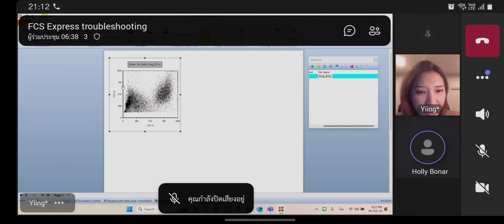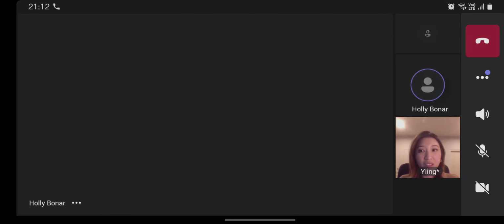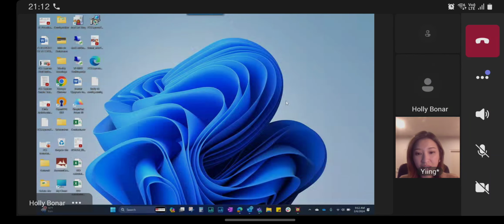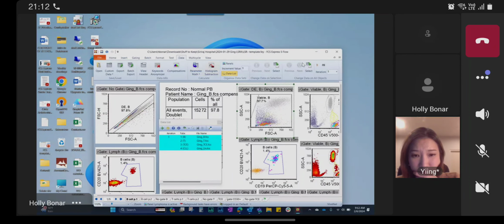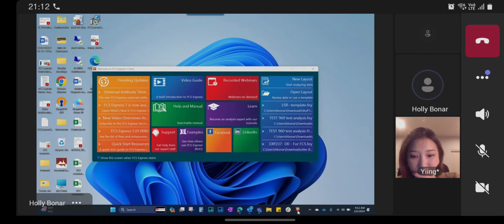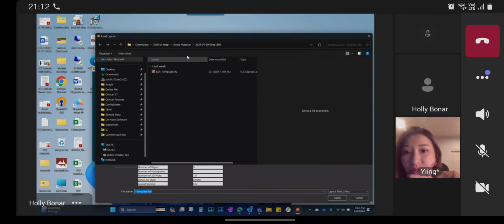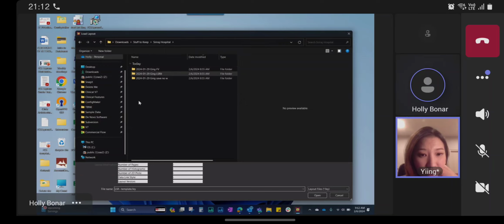Okay, I'm going to share my screen. Okay. All right, so I'm going to open, this is the layout that you sent me, right? So there are your 3 files, 3 folders, and we have LSR. So here's the LSR template.